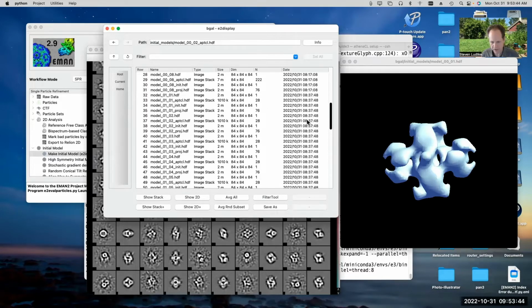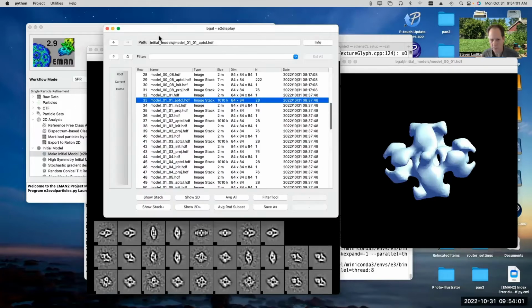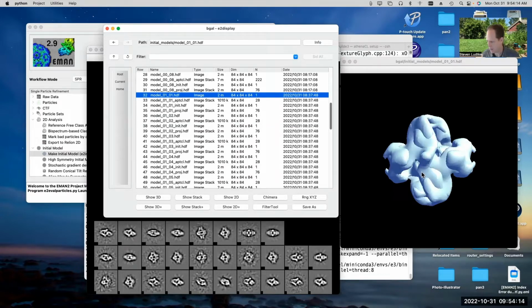Anyway, let's see what happened when I selected a set of class averages. So that was the second run. This is the first output from the second run, and let's look at the A particle file from that. Now there's fewer to compare because I only used 17 inputs. And oh, actually, look, that seems to have done a pretty decent job, right? All the class averages and projections here now seem to agree pretty nicely with each other. All right, let's take a look at number 2. And again, number 2 also seems to agree fairly nicely. Each class average and each projection seems to agree pretty well. So let's take a look at this 3D map.